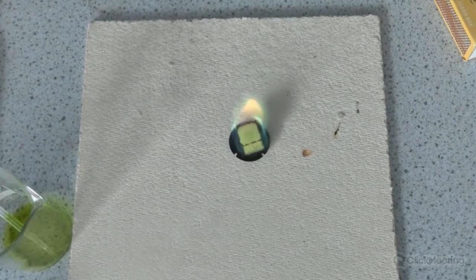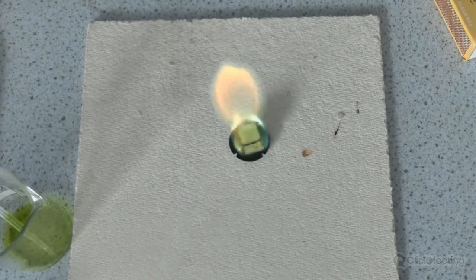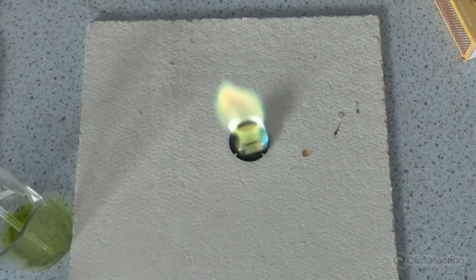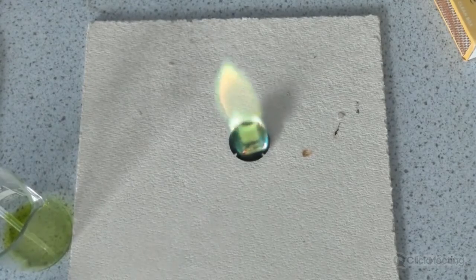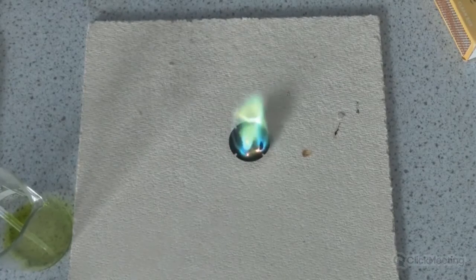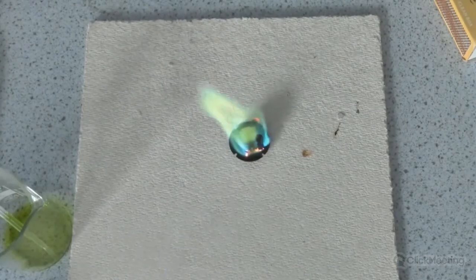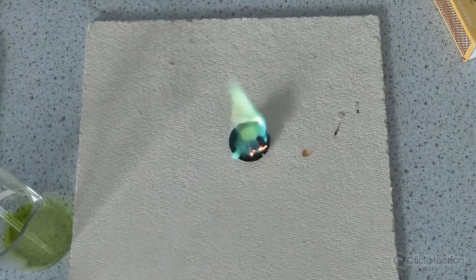So this allows people, and I have had people looking at this with simple spectroscopes, to talk about electrons being promoted and dropping down to lower energy levels and releasing certain wavelengths of light and so on. So they can get spectral emission lines looking through simple spectroscopes from this. It gives a slightly longer flame as well. In addition to this, you can see that a carbon snake is starting to come out of the bottle top.